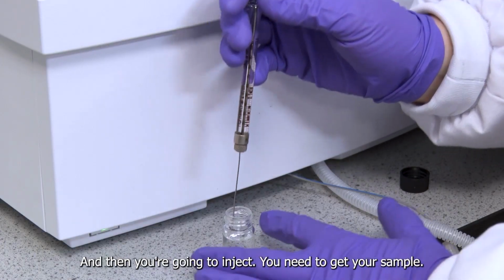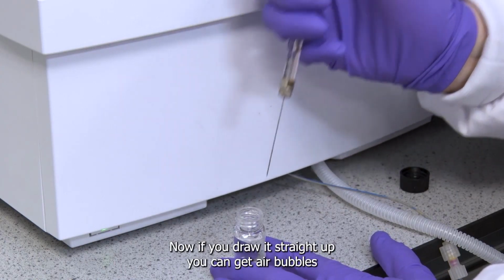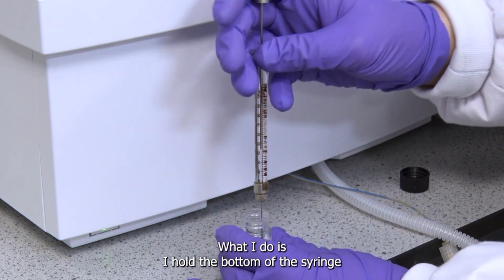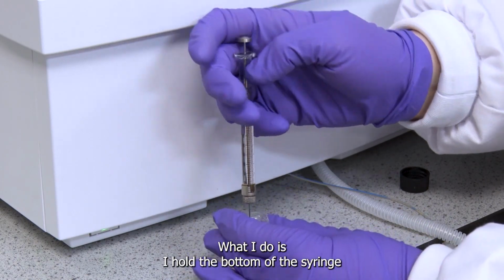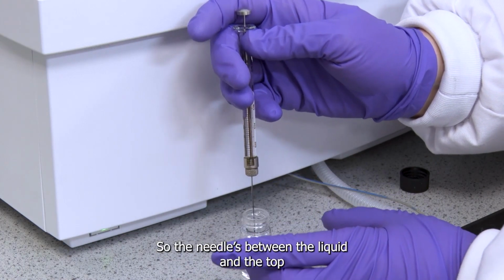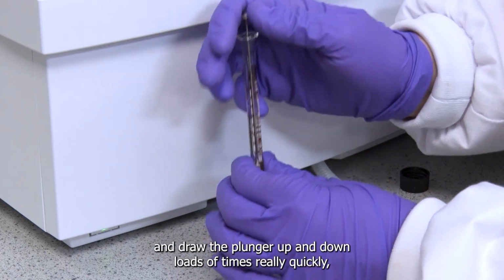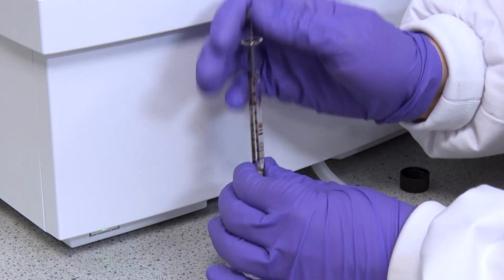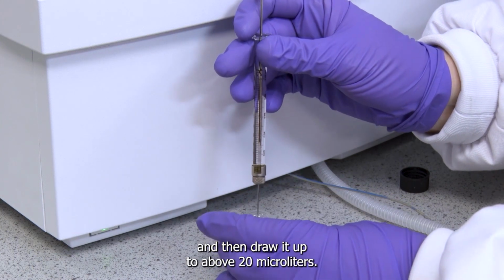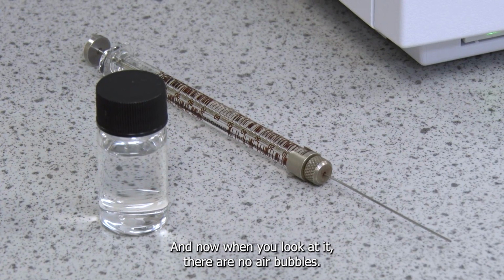You need to get your sample, so put your needle in. Now if you draw it straight up, you can get air bubbles. To avoid that, what I do is I hold the bottom of the syringe, so the needle's between the liquid and the top, and draw the plunger up and down loads of times really quickly, and then draw it up to above 20 microlitres, so I've got it about 30, and now when you look at it, there are no air bubbles.